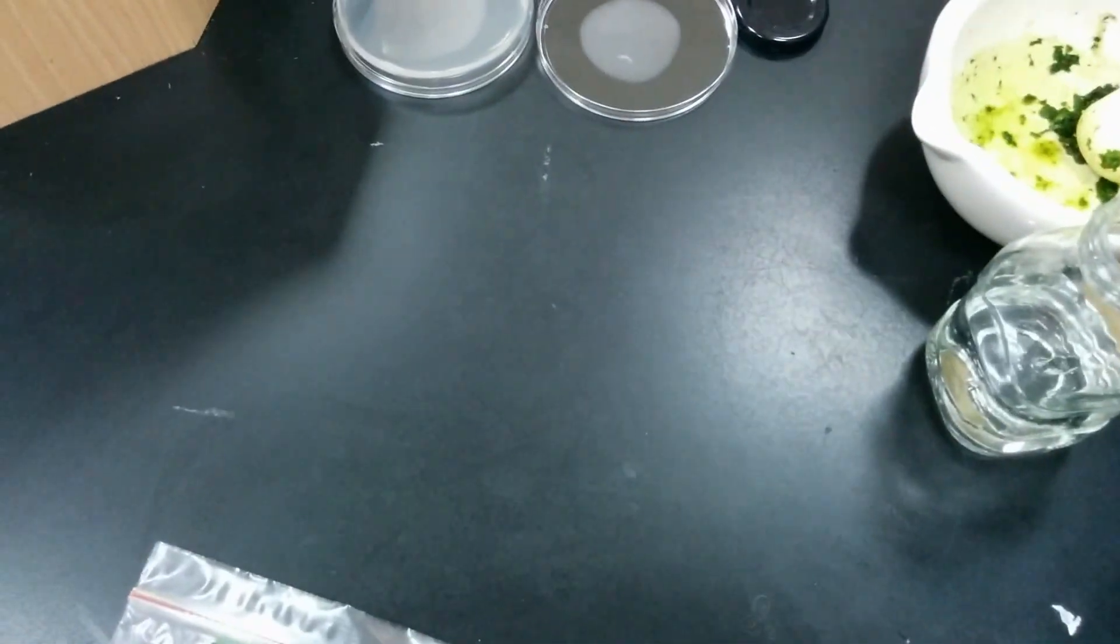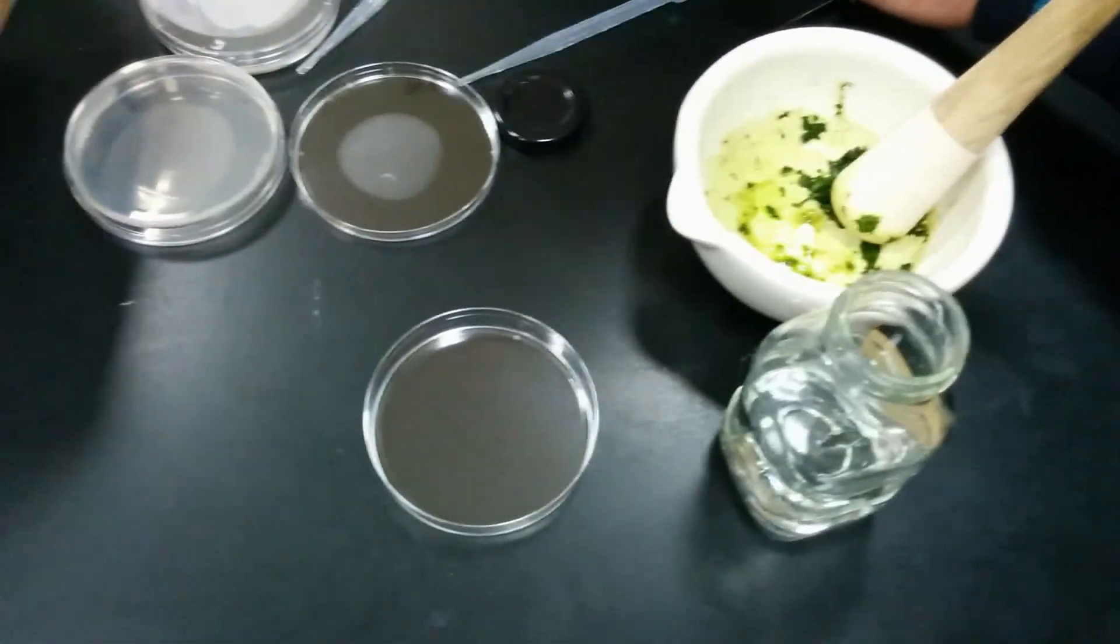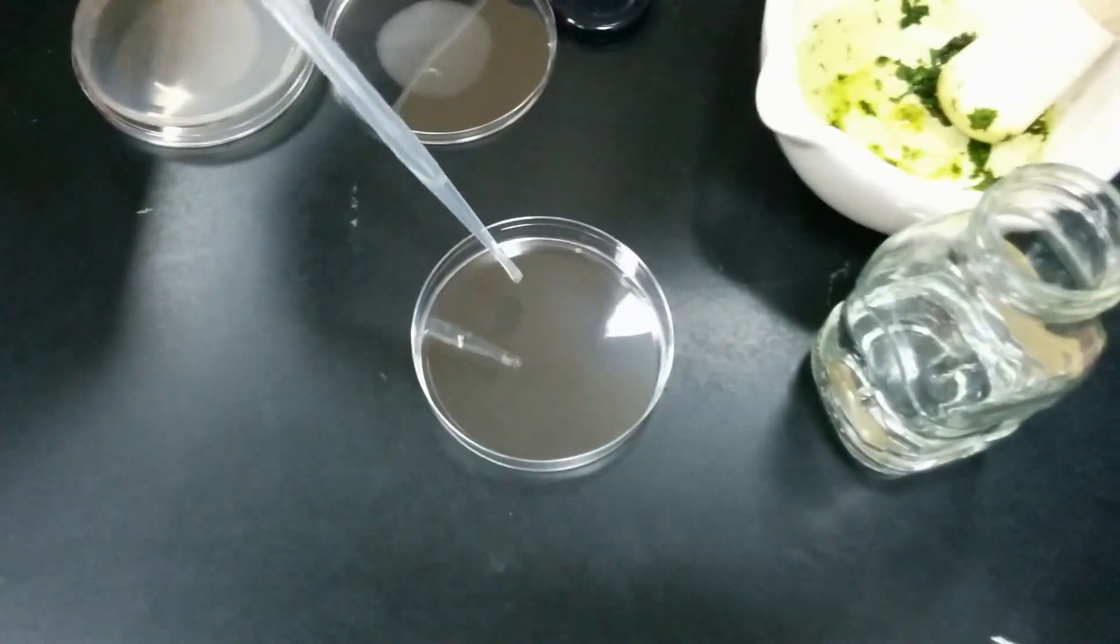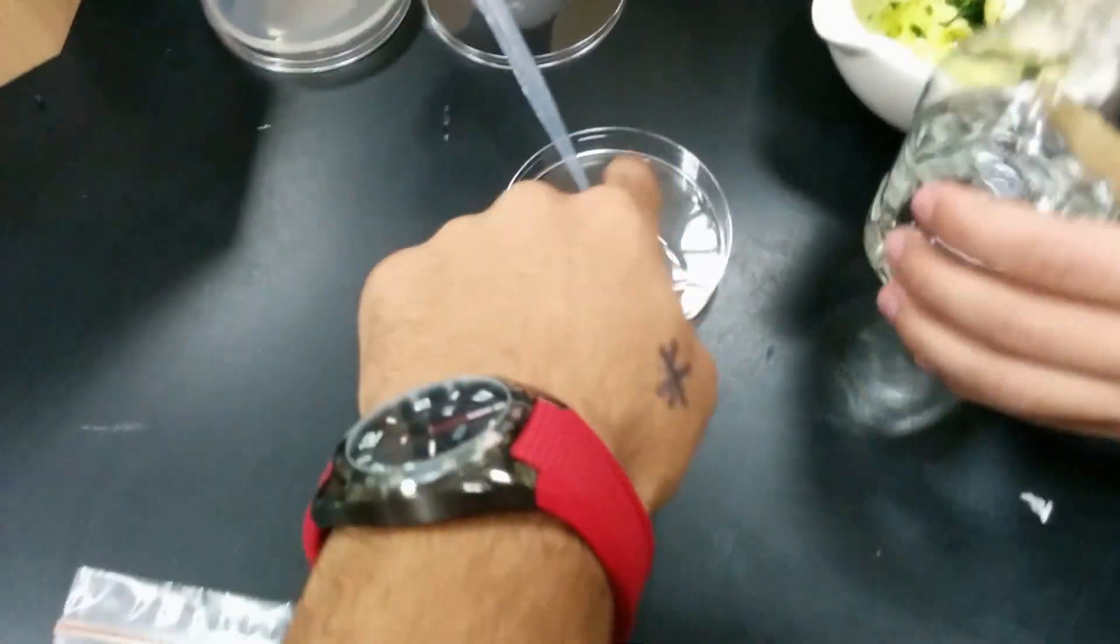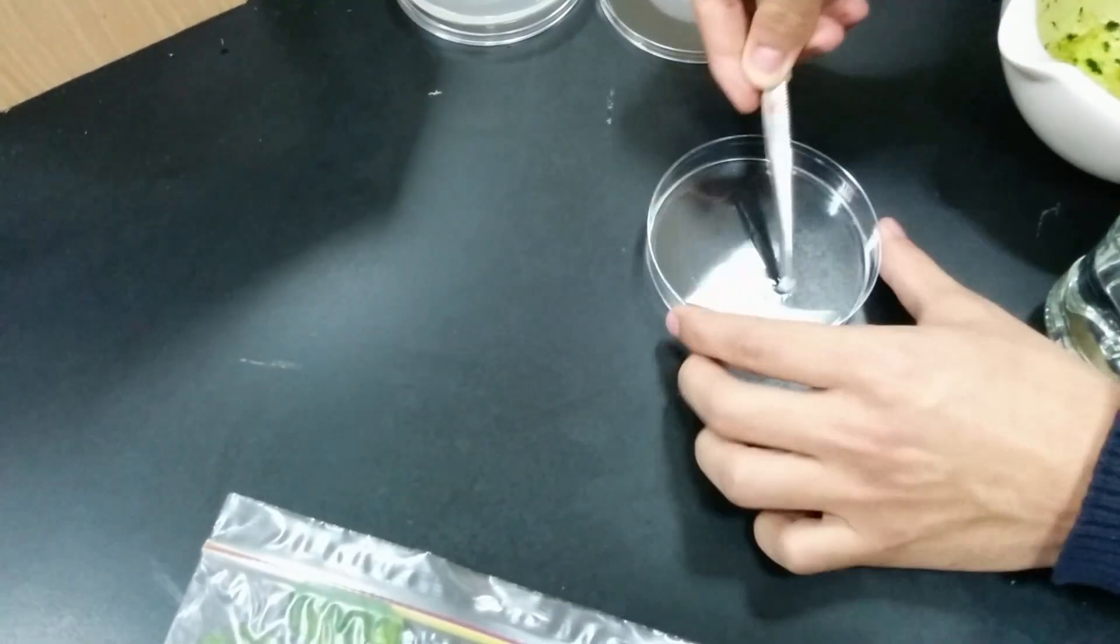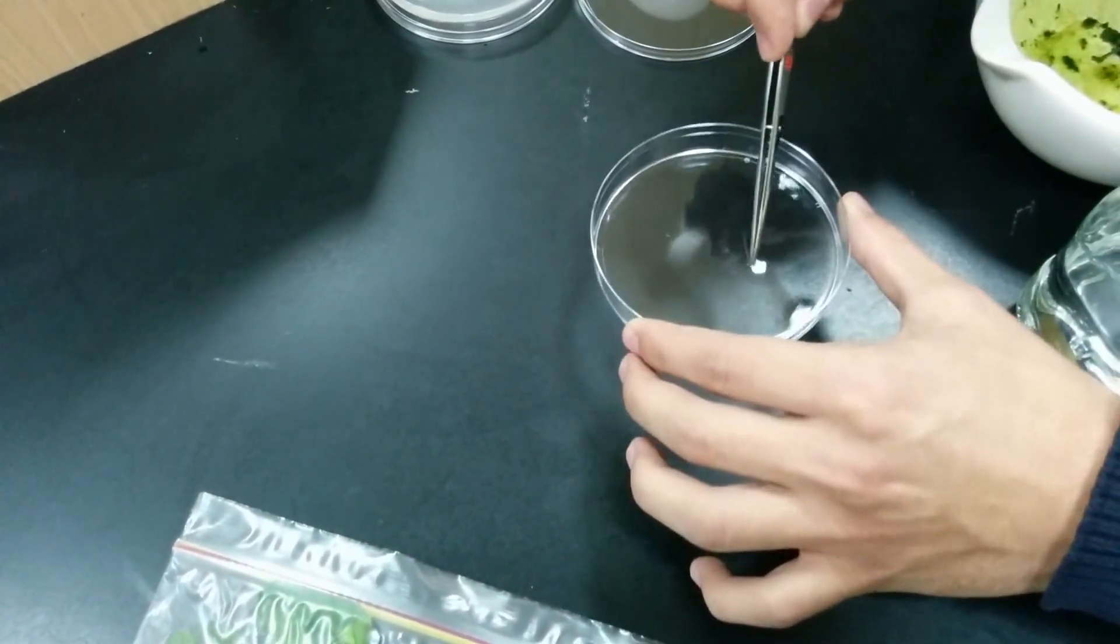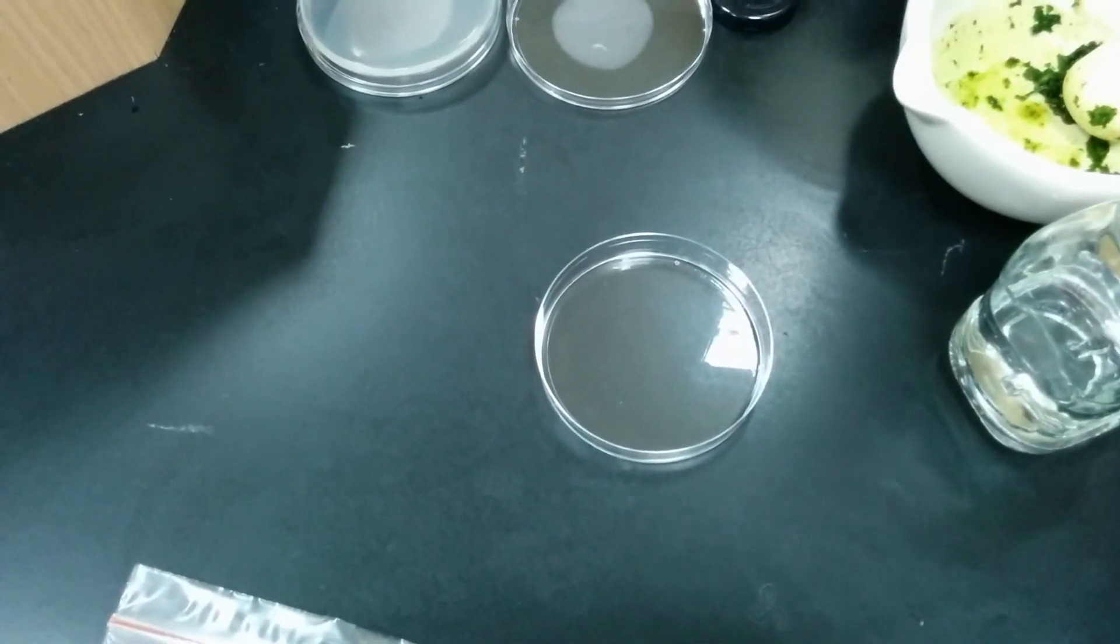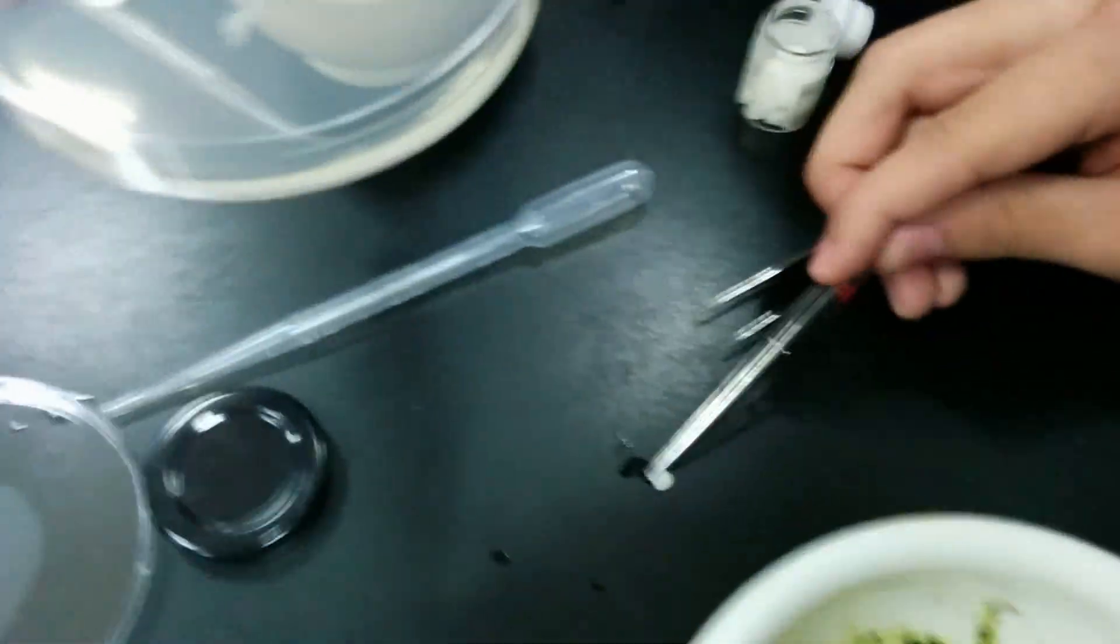We're going to take a paper disk, dip it into alcohol, and place it here.